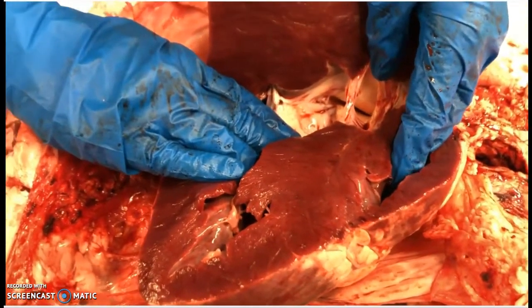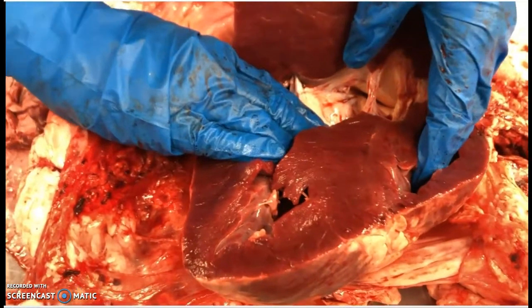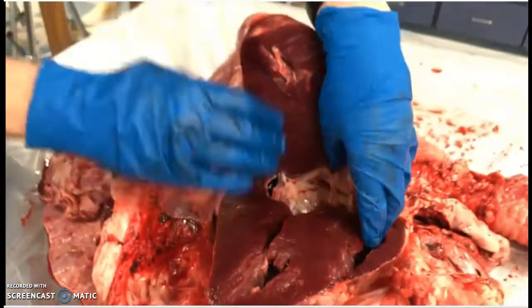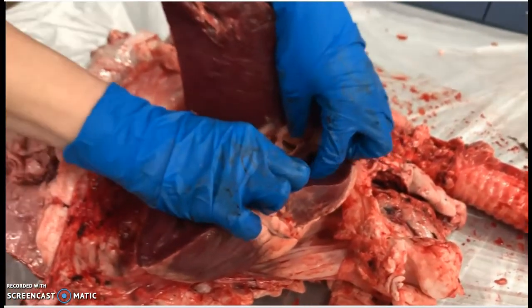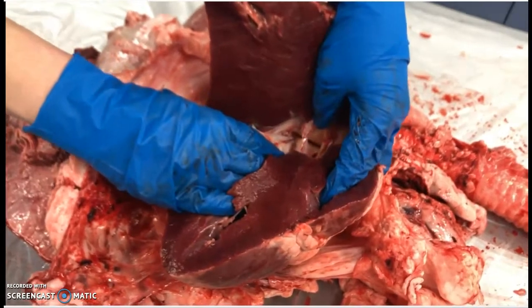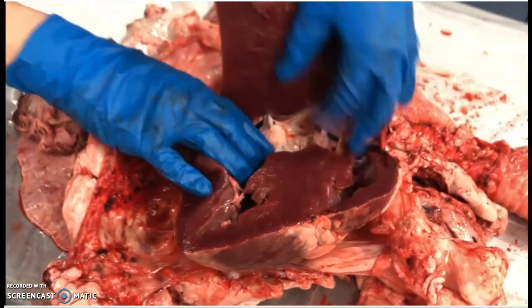Before a baby is born, this septum is not completely formed. There's actually a hole between it because babies get their oxygen from the placenta, so it doesn't matter if blood goes to their lungs or to their body if it mixes. Once a baby's born, there's a pressure differential change that causes those to seal up. As long as they seal up correctly, everything's fine — but there are times when that doesn't seal properly.